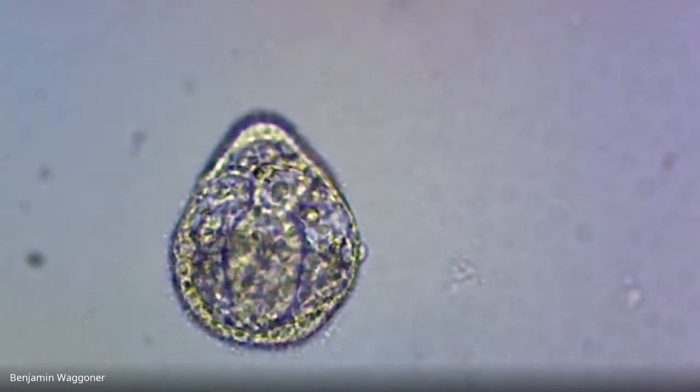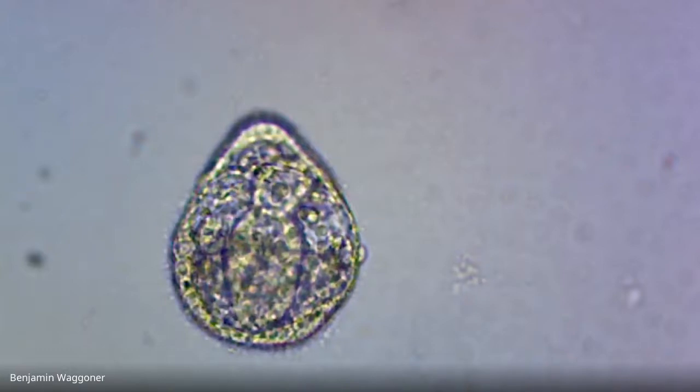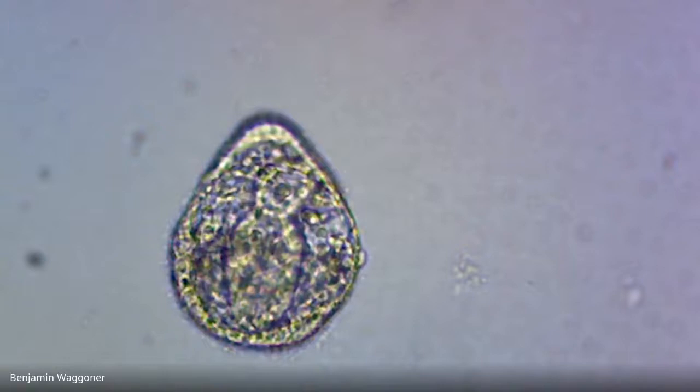Okay, what I'm seeing is that in the nickel tank, we ended up with a lot of screwed up larvae. The problem with interpreting that is, first of all, because the control tank got so full of bacteria, I don't really have a normal to compare it with.